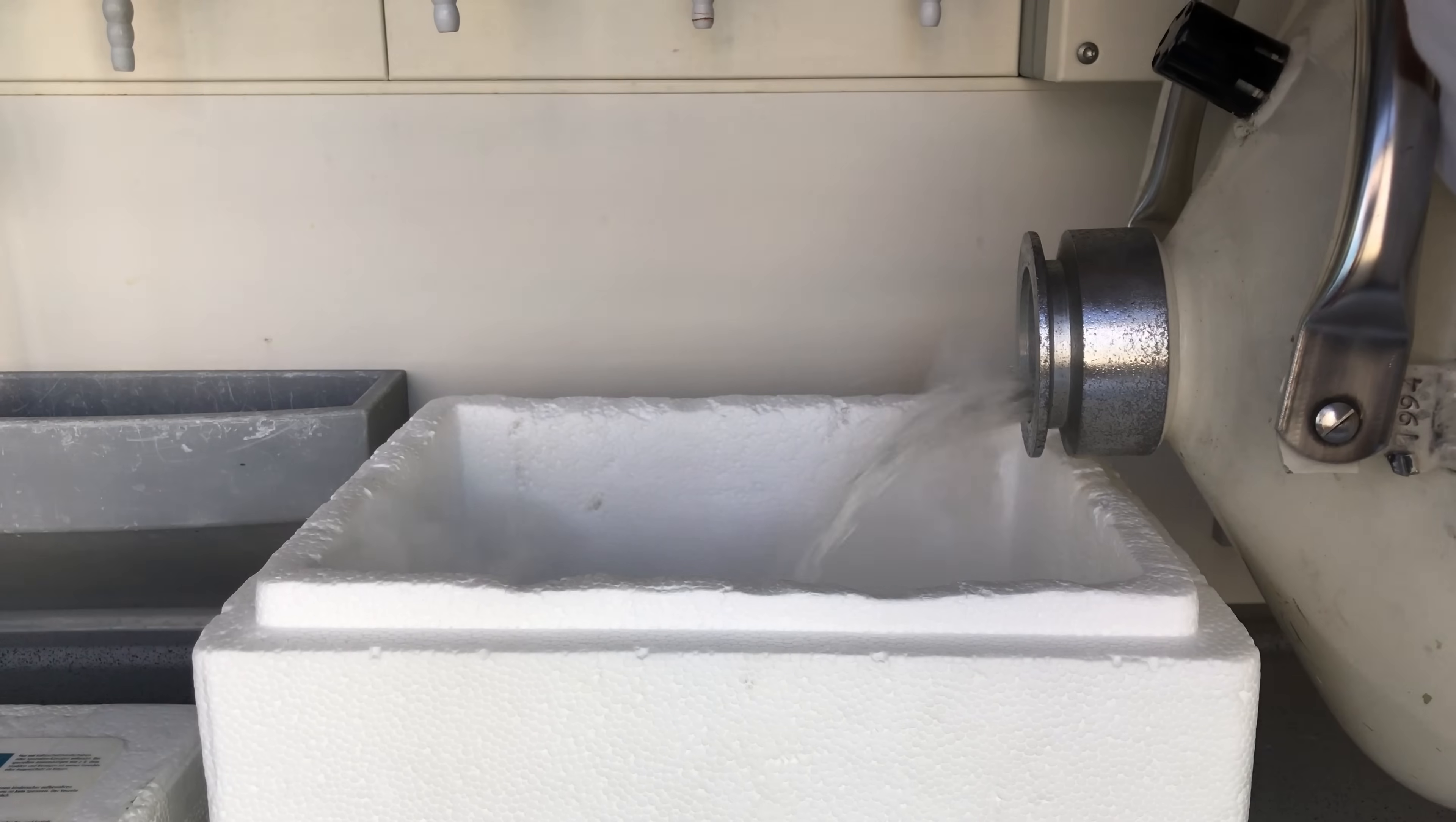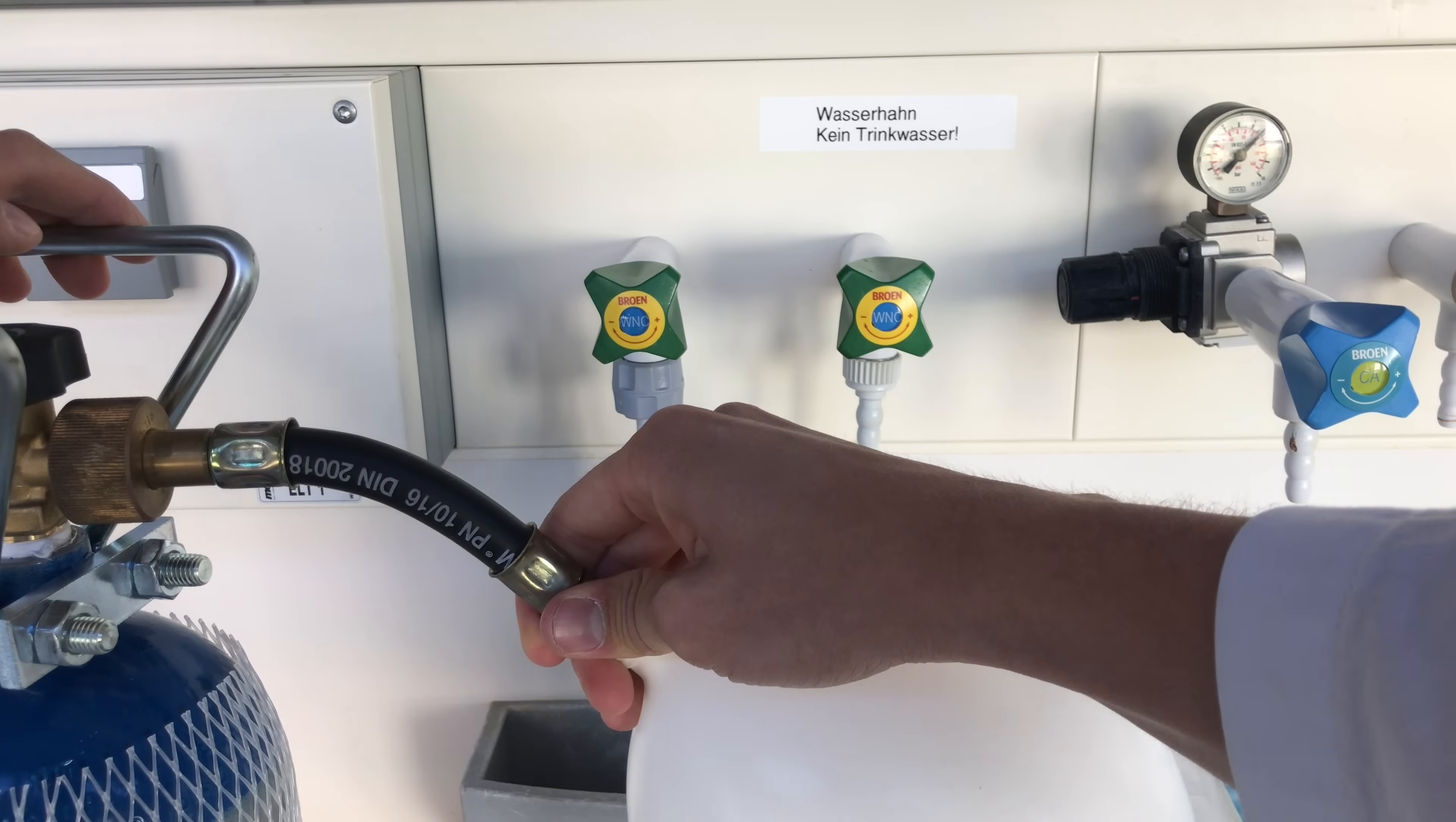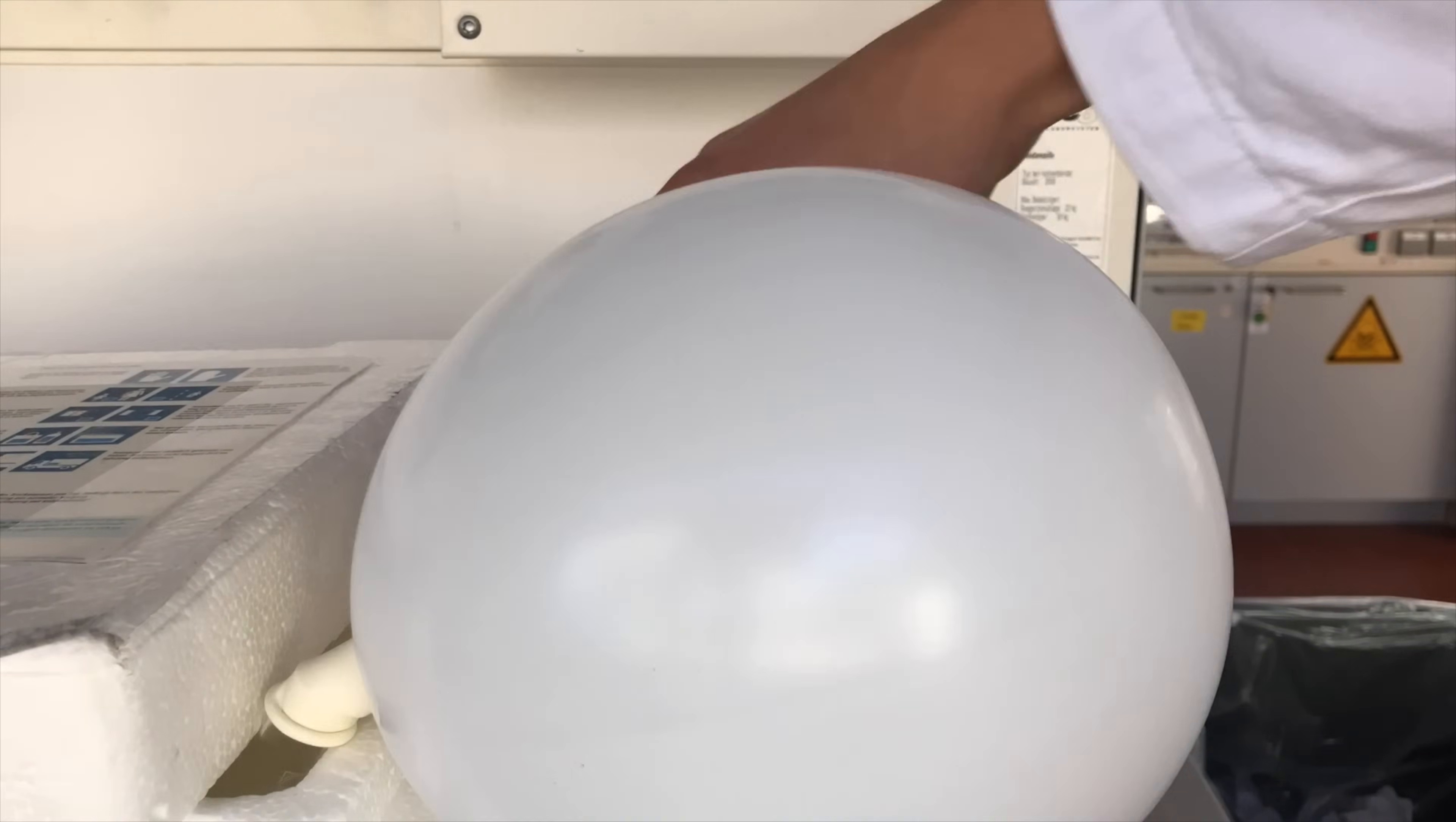Most of you including me have never seen solid laughing gas before and I wanted to see what it looks like. I also wanted to show a reaction with it. To solidify laughing gas efficiently I filled up this balloon, connected it to a test tube and stuck it into liquid nitrogen. A few pieces were taken out and there you go, this is what solid laughing gas looks like.